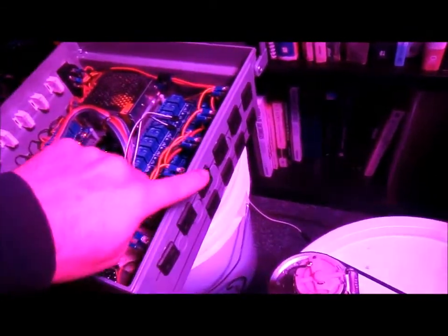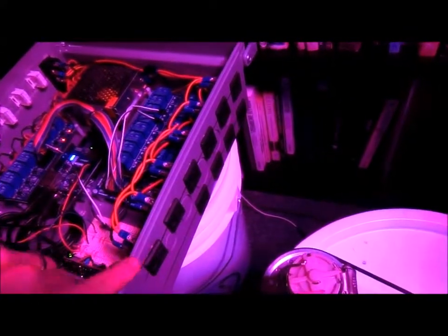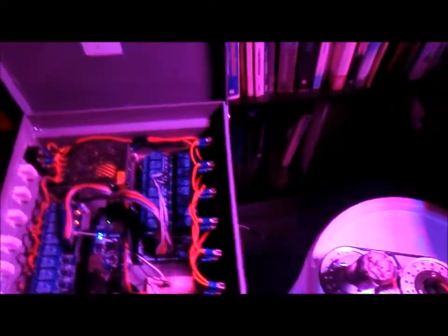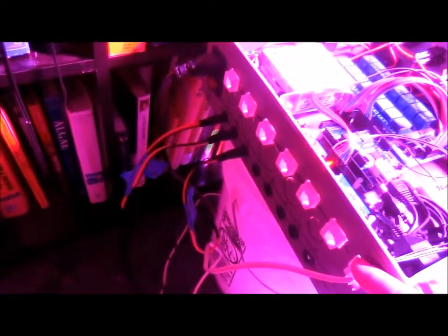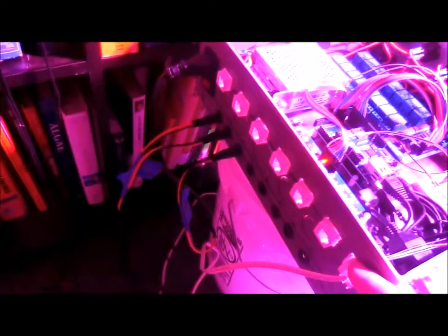These are all three-prong inputs for normal AC units, and on the other side here are the DC plugins right here, as well as all of our sensor inputs for the system.